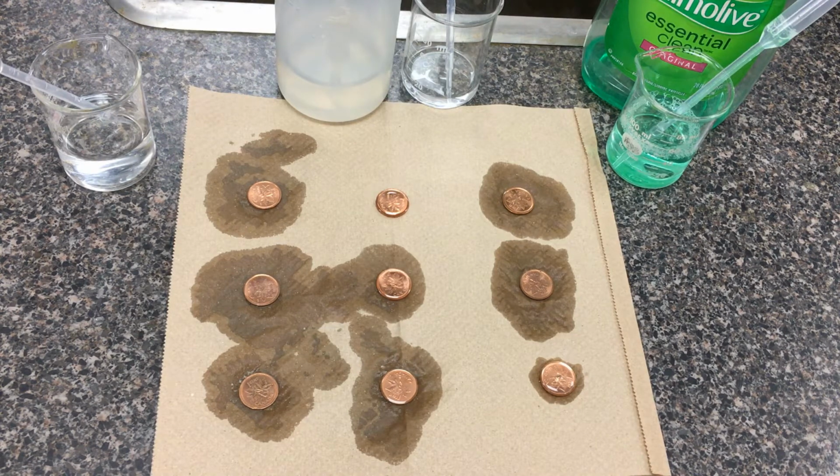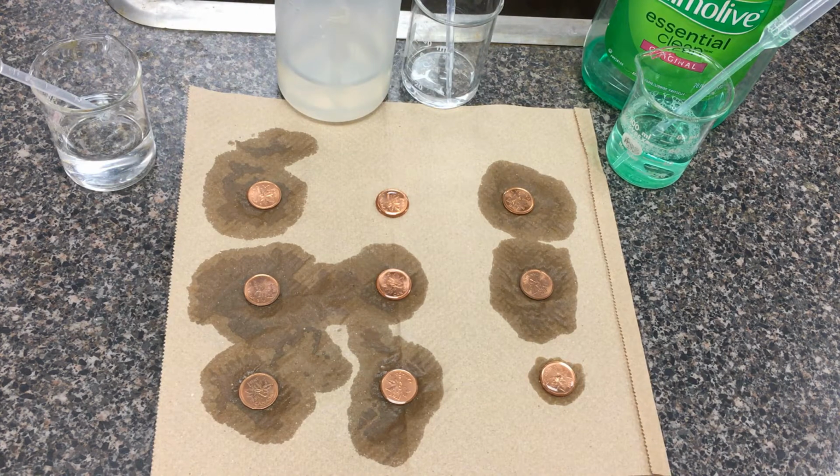As you start thinking about the design of this experiment, when you start talking about error analysis and what you can do differently next time, although I tried to control variability like the surface area of the penny, you can ask yourself, would it be better for me to have used one penny and cleaned it off in between, or the way that I did it here? When you talk about errors, make sure you use terms like random errors and systematic errors, and then try to go beyond just saying, let's use better droppers, better equipment, steady hands and things like that. All of those things are true, as are repeat trials, but try to think about the procedure, the design of this experiment, and see if there's anything you can do differently the next time.